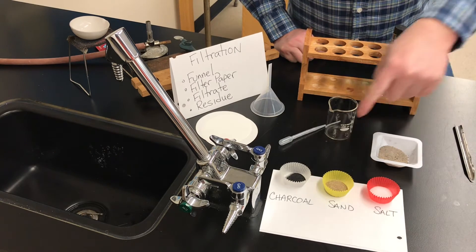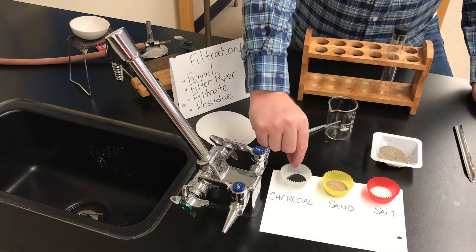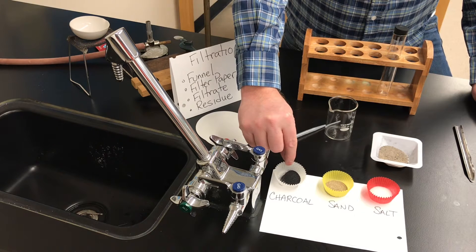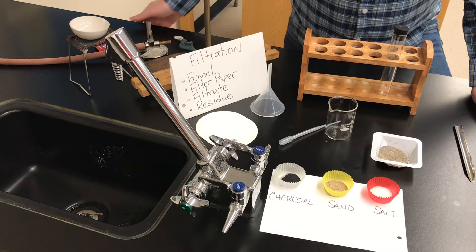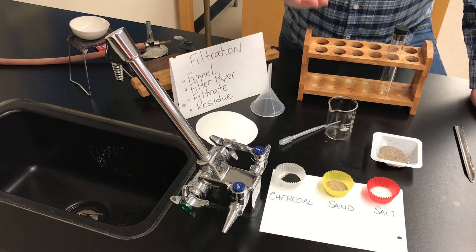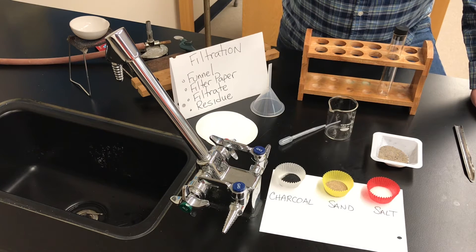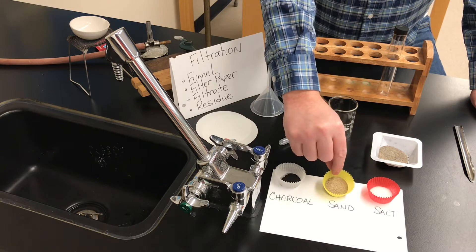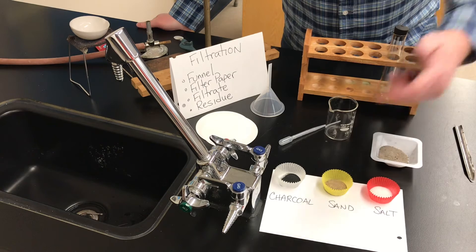We have three solids. We have charcoal — charcoal is a black powder, it's insoluble in water, it's insoluble in alcohol, so it does not dissolve in either of those things. It's very fine and will stain your hands black. Charcoal is like ground-up pencil lead in a way. We also have sand — we did an experiment earlier with the percentage of air in sand — that's just normal sand.